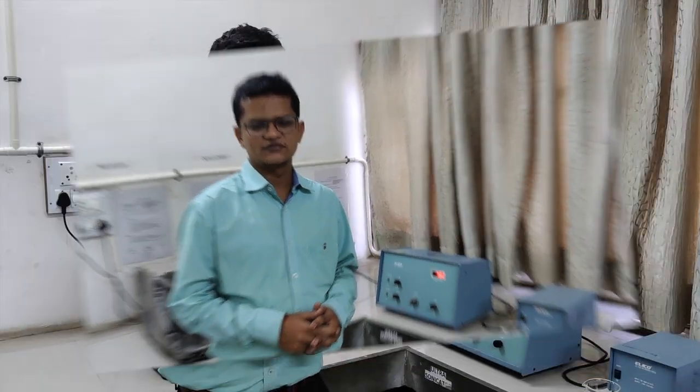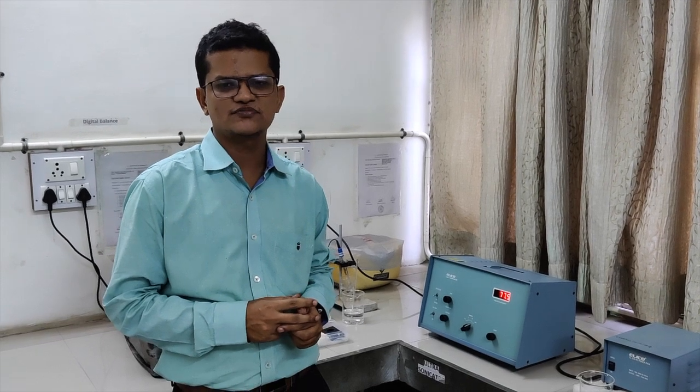Next, we will discuss the operation of the fluorimeter. Going towards the operation, first we will discuss the various instrumentation parts of the fluorimeter. The fluorimeter consists of first a light source like mercury vapor lamp, second a filter, that is a primary filter, third one is a sample holder which holds the sample, fourth one is the secondary filter, and fifth one is the detector.